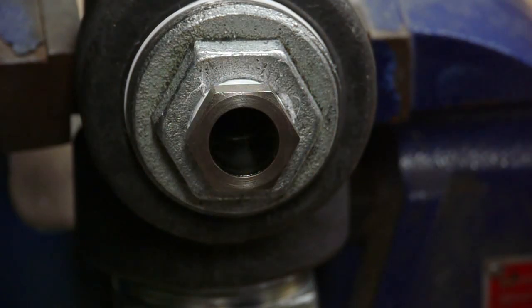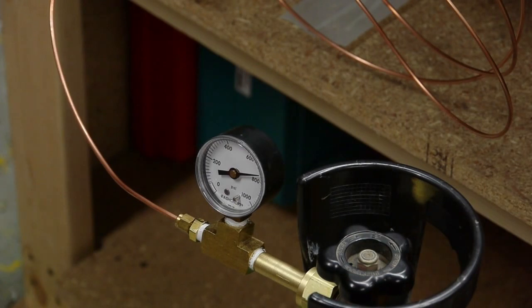The pressure gauge on a CO2 system is not very indicative of how much liquid or gas is in the tank. It's actually only an indicator of the outside air temperature. Inside the tank there's a mixture of liquid and gas, and the pressure will be the same for a given outside temperature, regardless of how much liquid is actually in the tank.